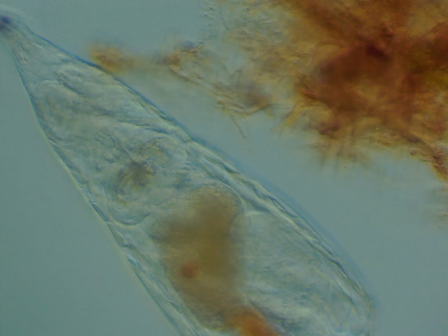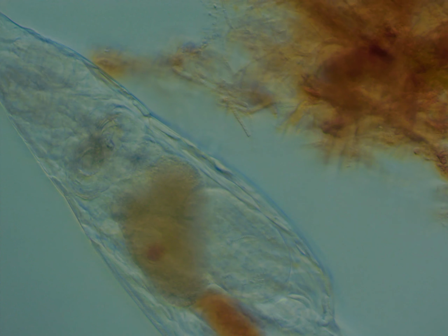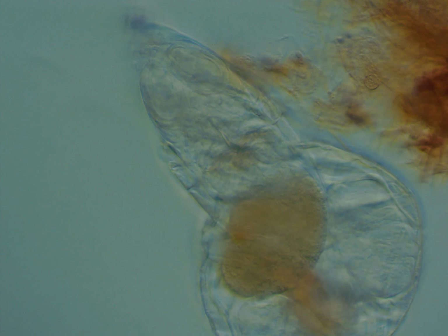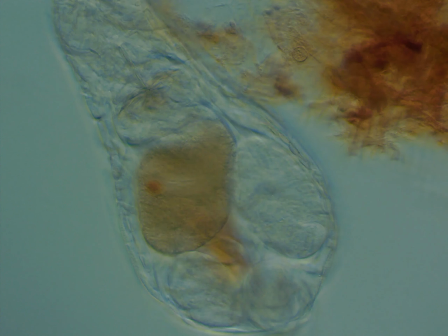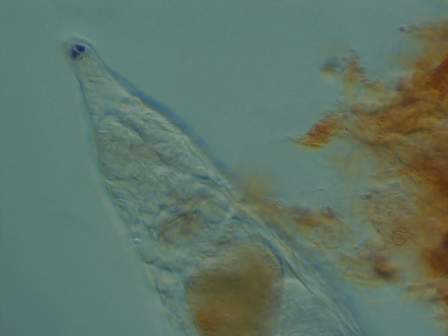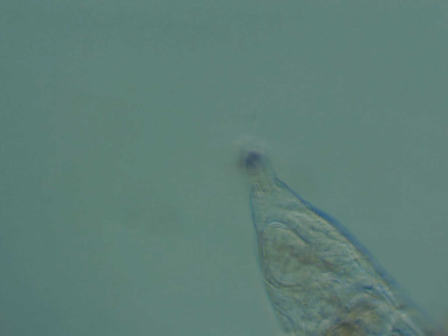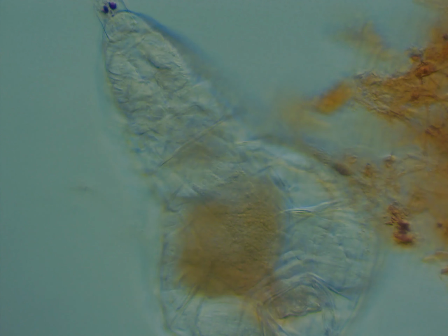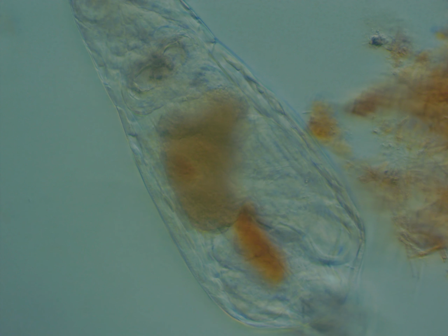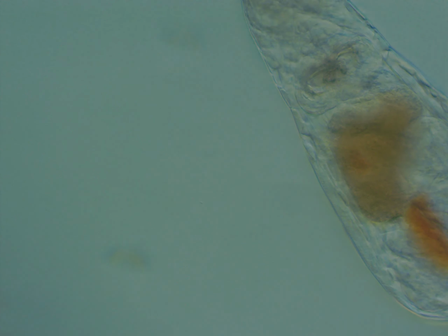And here is where the oblique illumination part of this video begins. So what oblique illumination is, you block out half of your iris diaphragm's, well, your condenser basically's width. And by doing that, only one side or one pinhole is illuminated, causing light to only come from one side or one section of the filter. In this case, I only did it with my filter holder. I didn't actually use a filter to do this.